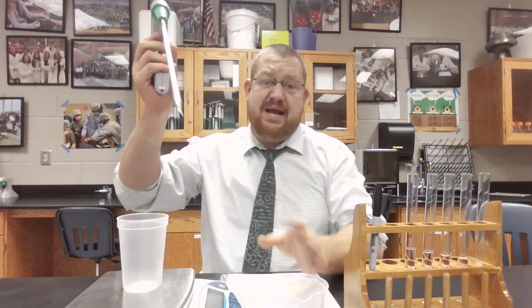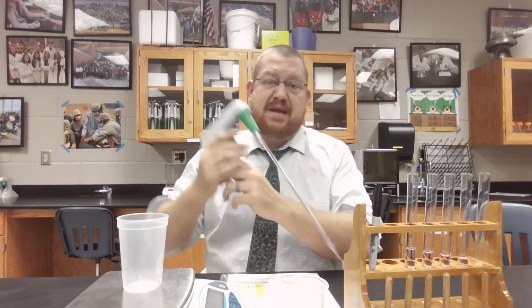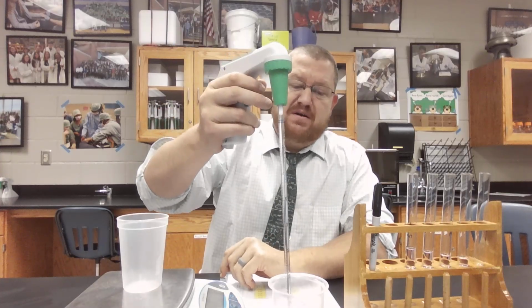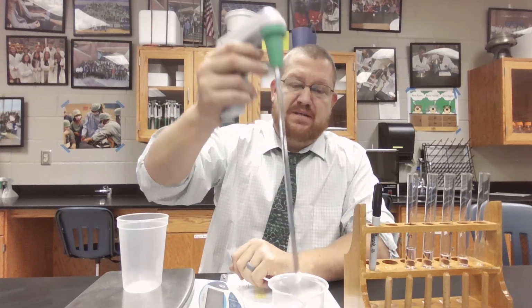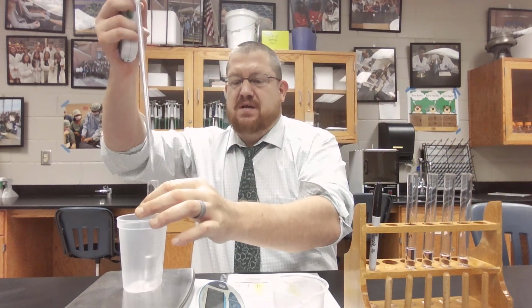So we'll do that, and then we will pipette out specified amounts. We do 2, 3, 4, and 5. So we learn how to use the pipette. We also use a manual pump, but we will draw our liquid up into the container, and then we will load it into our test tube. And then we will take the new mass of that specified amount. We'll repeat this, 2, 3, 4, and 5, and fill out our data table.